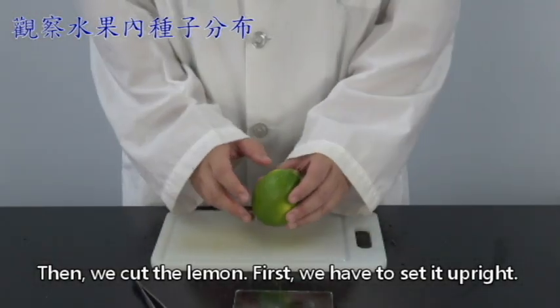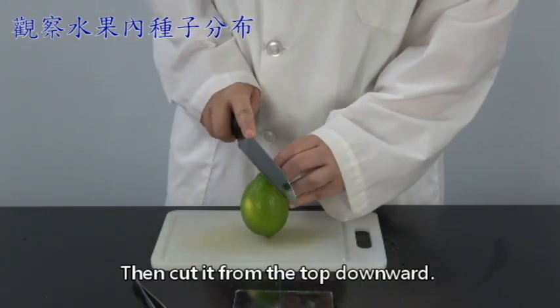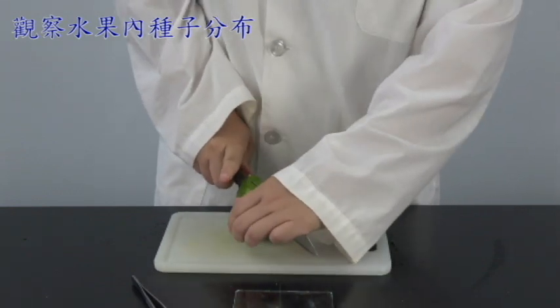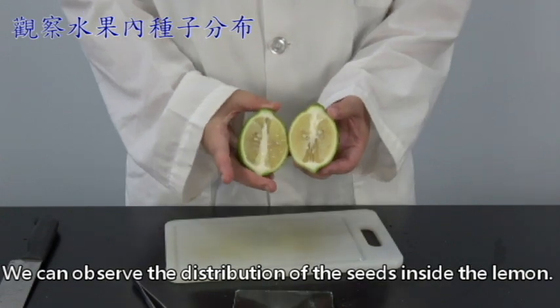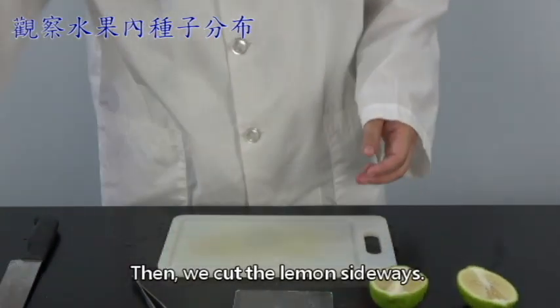Then we cut the lemon. First, we have to set it upright, then cut it from the top downward. We can observe the distribution of the seeds inside the lemon. Then we cut the lemon sideways.